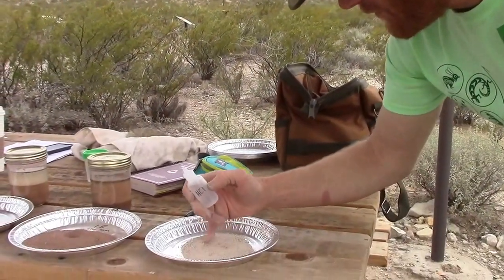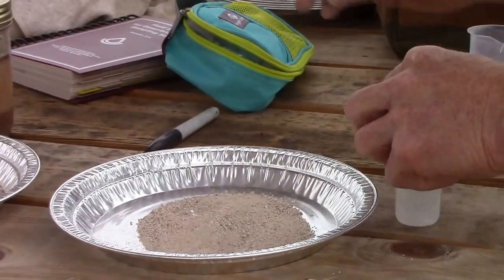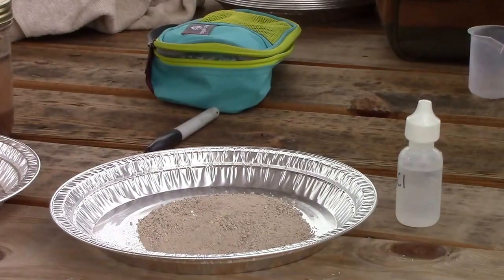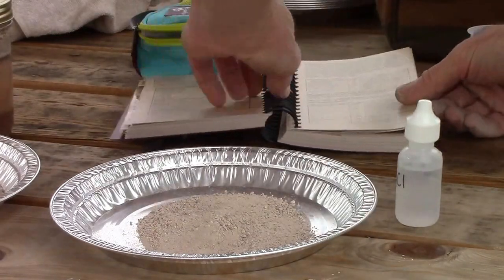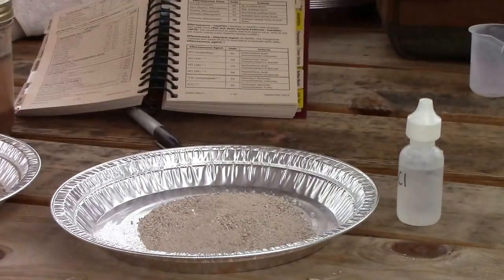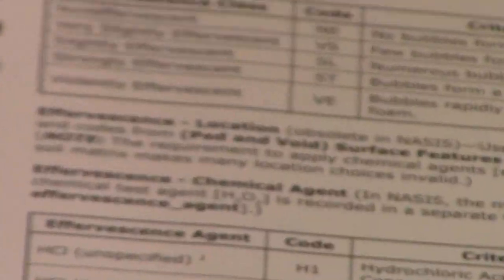We'll just drop a couple of drops on these, and based on how many bubbles arise, this is defined by NRCS in this chart here as an effervescence class. We have five different possible classes, ranging from non-effervescent to violent.